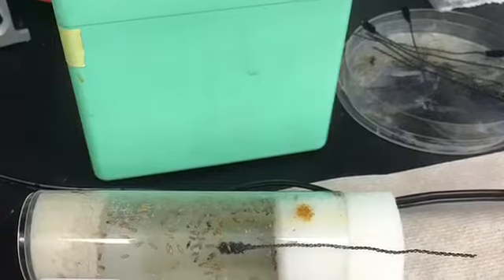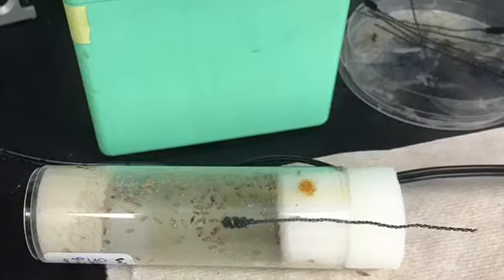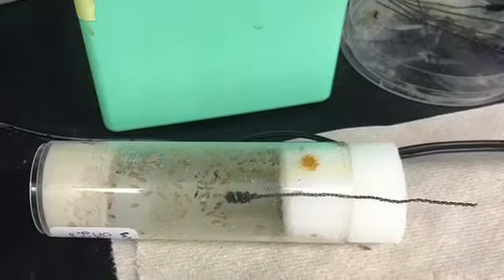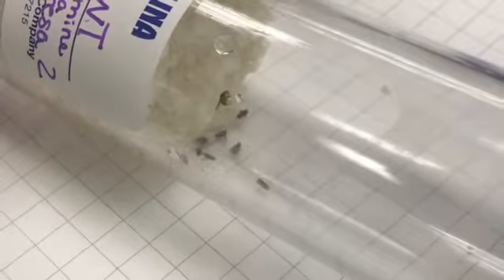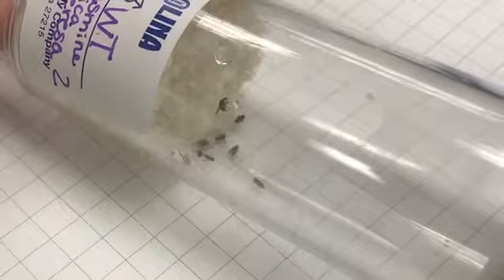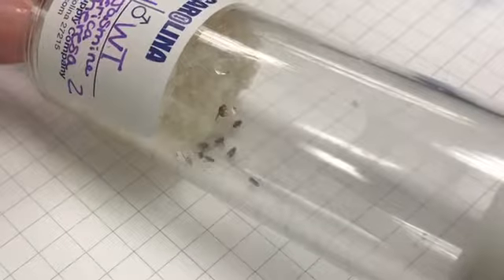7 days later, FlyNap was then administered to the F1 progeny in order for them to be easily handled and observed for their sex and phenotype. After the progeny was observed and the results were recorded, 5 females and 5 males from the F1 progeny were placed into a vial to create an F2 progeny.